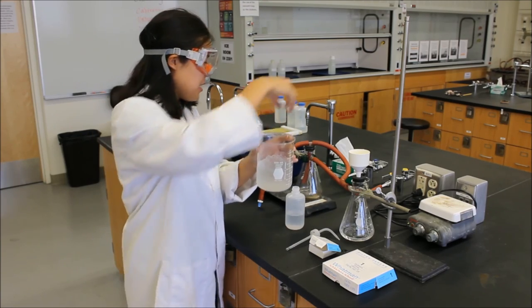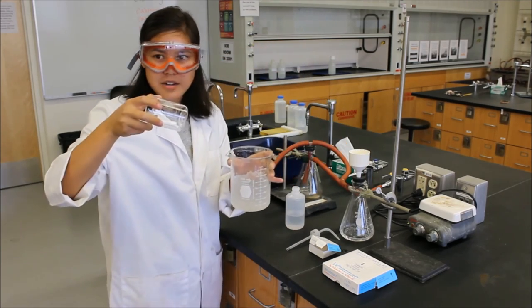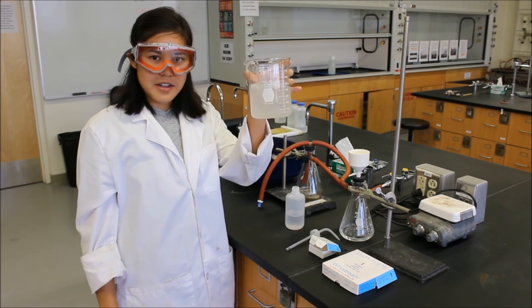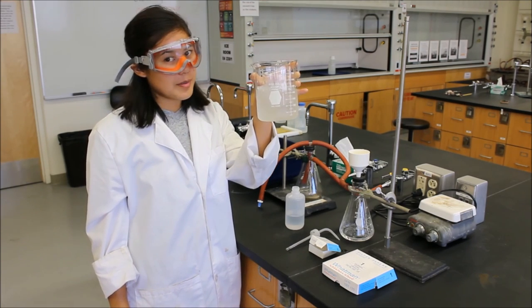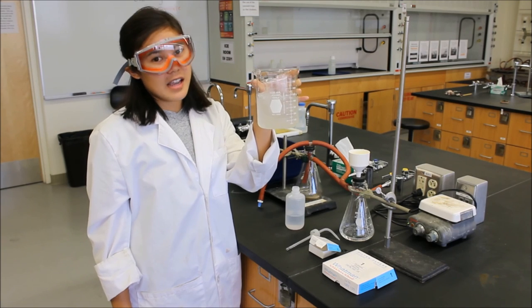You can make a little hole in there, and your beaker just sits right in there so that it can cool, and you can make other crystals, and it's all a good time.